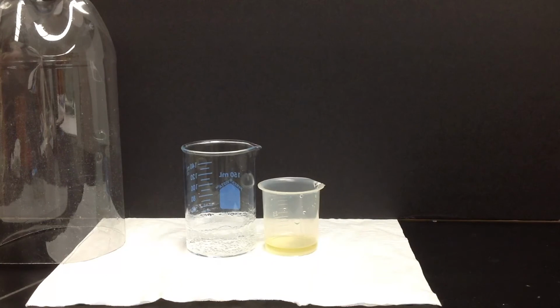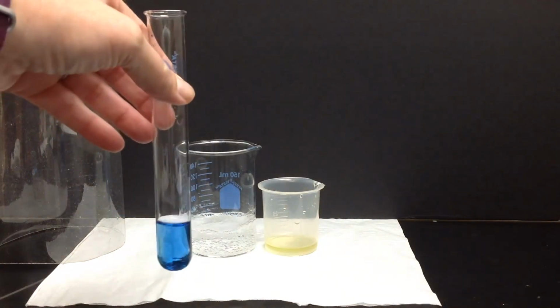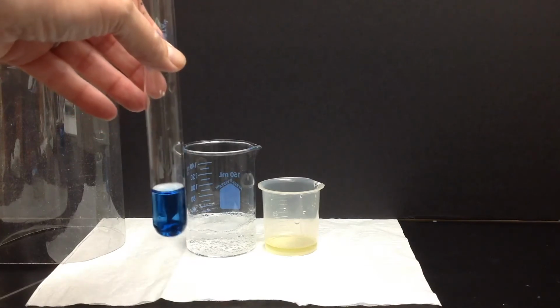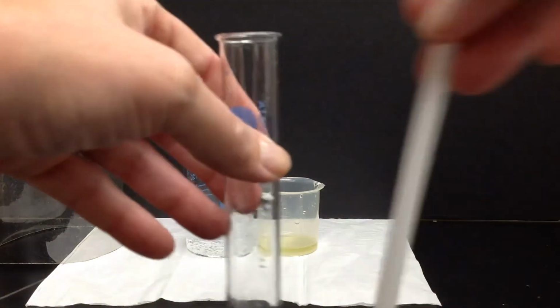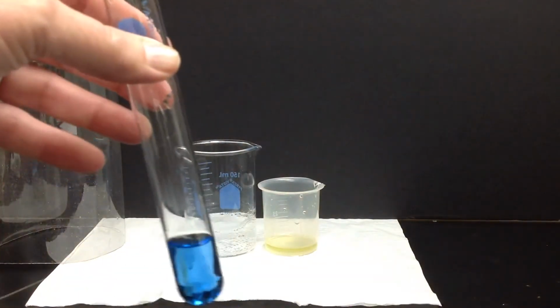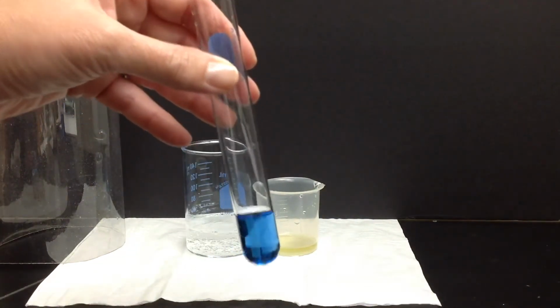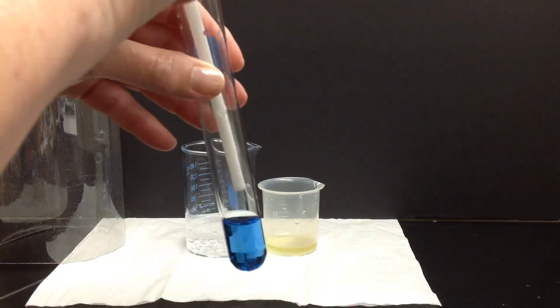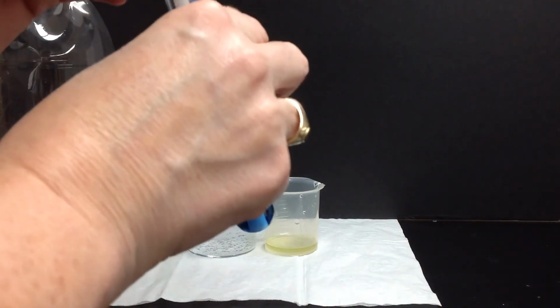And part two of this demonstration is going to be very similar. I'm going to have a test tube with that bromethymol blue solution, and I've got a straw. Okay. And I am going to be blowing into the test tube. I'm not drinking it, and I'm going to blow into it gently. So I think that's on camera. So let me just make sure I stay on camera with that, okay? I hope it's still on camera.